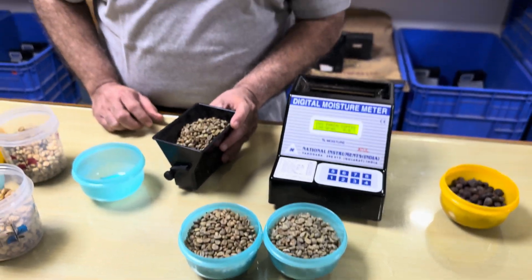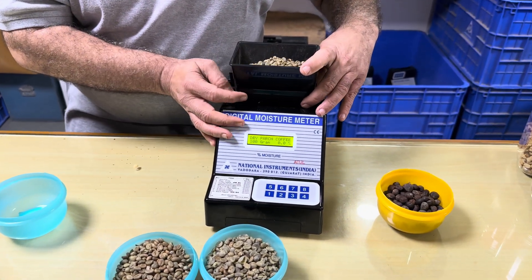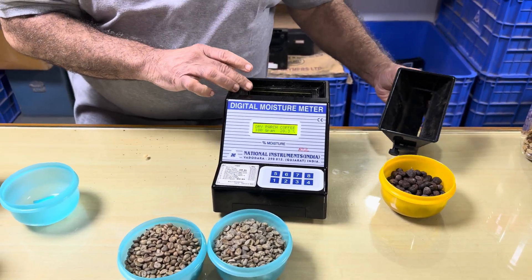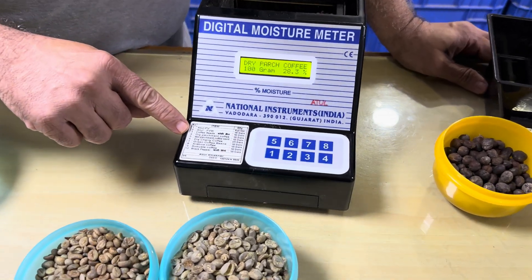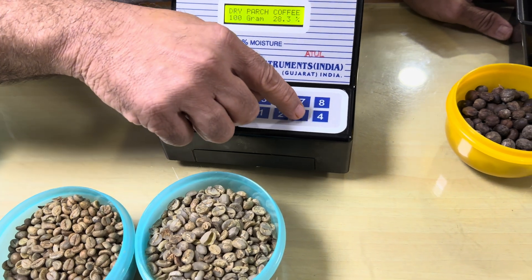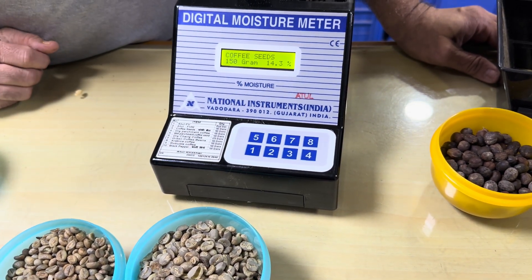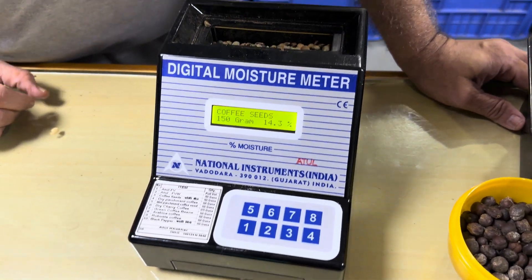Remember, for coffee seeds you have to take 150 grams. I am pouring this sample — 150 grams. The coffee seeds are in channel 3, so I have to press the number 3 key. It shows 14.3% moisture in this particular sample.